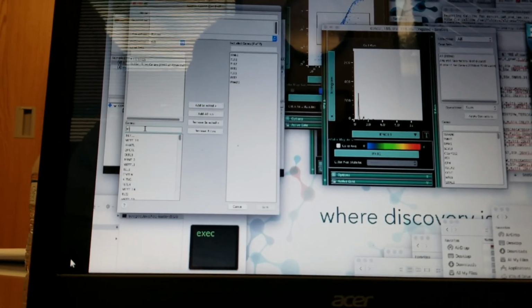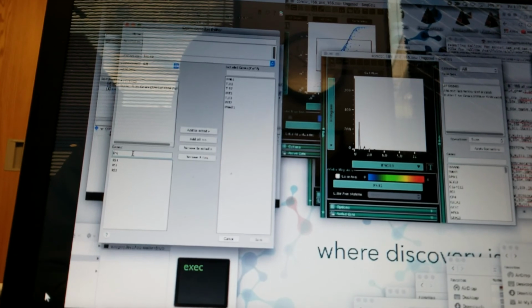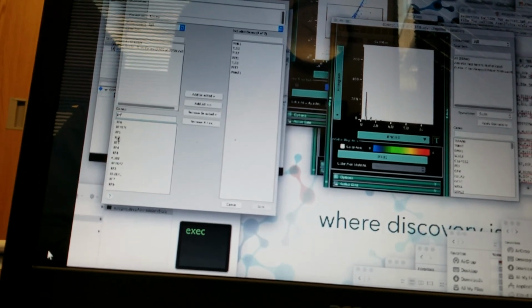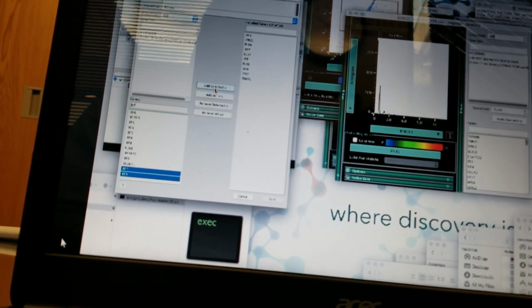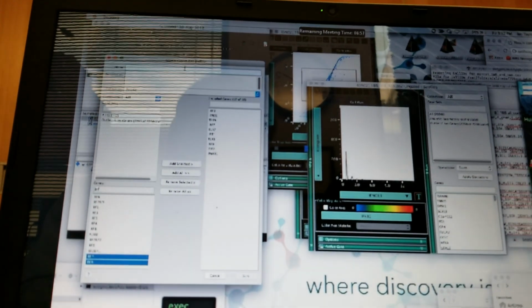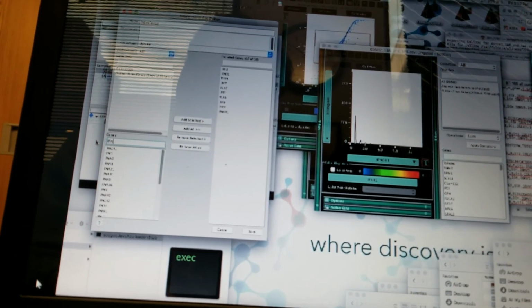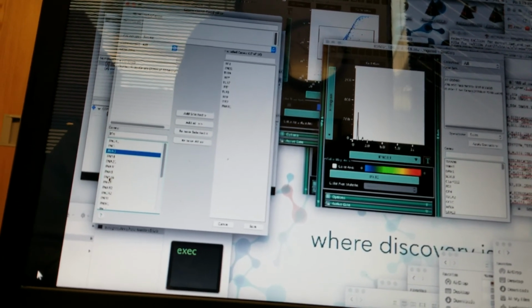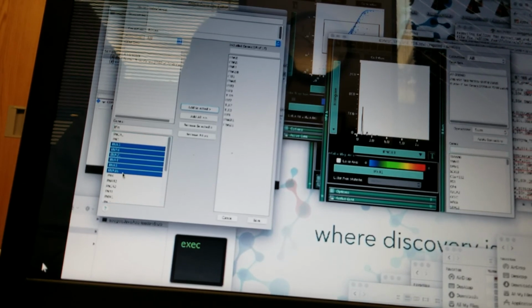So we typically like to look at total reads versus cells. IRF 3, 7, and 9. Right. So that's a pretty good gene set. Any type 1 interferon, IFNA, yeah, IFNA something. Any of them. Anything that's IFNA. Right, you get them all.